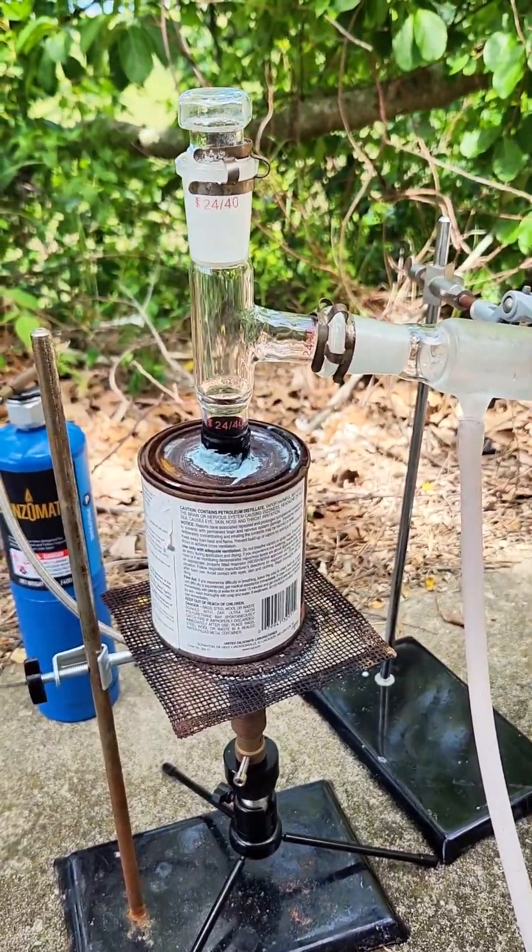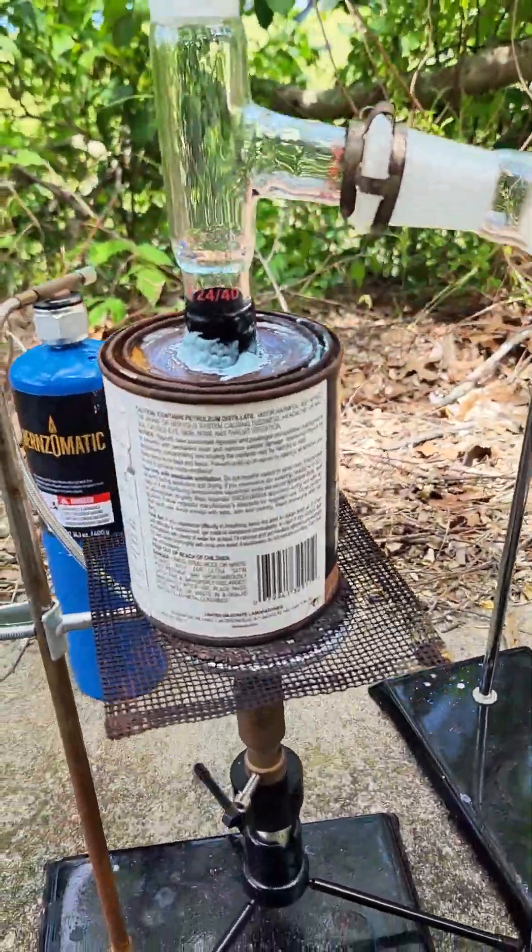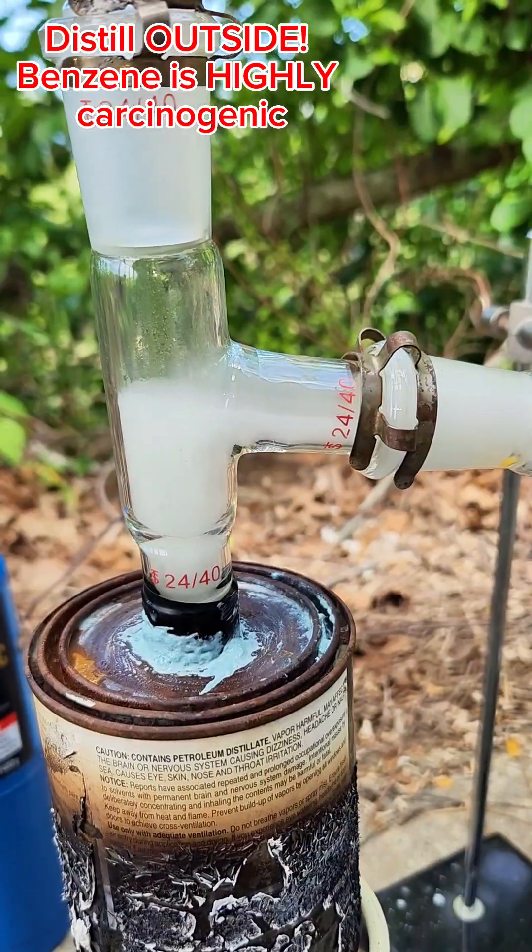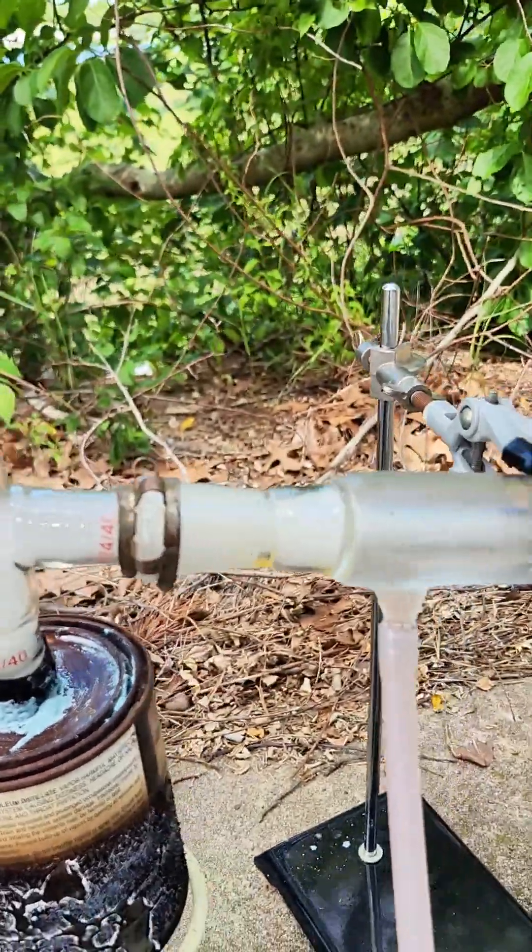I carry this all outside and set it up for a simple distillation over a Bunsen burner. I chose to do this outside because benzene is a proven and fairly potent human carcinogen, and I want to stay as far away from this as possible.